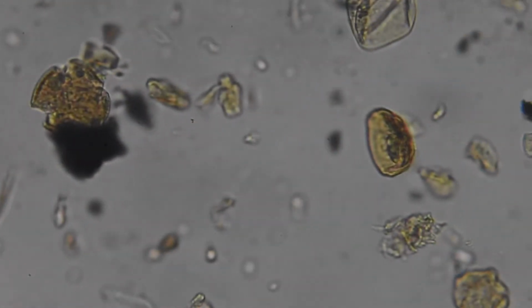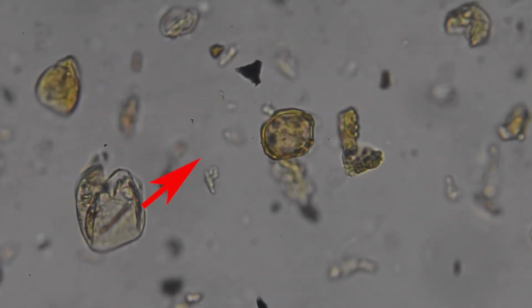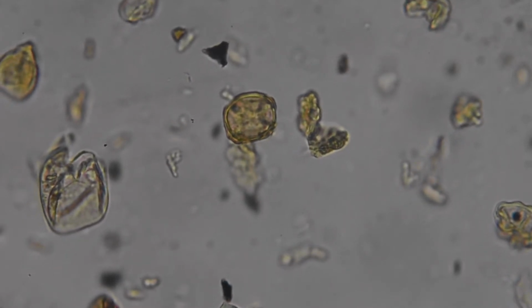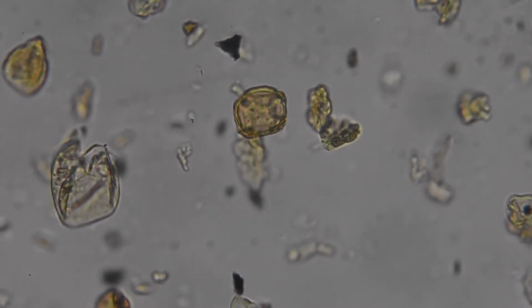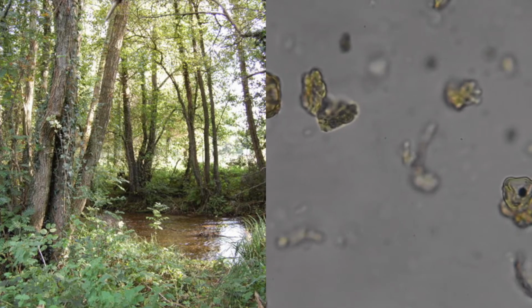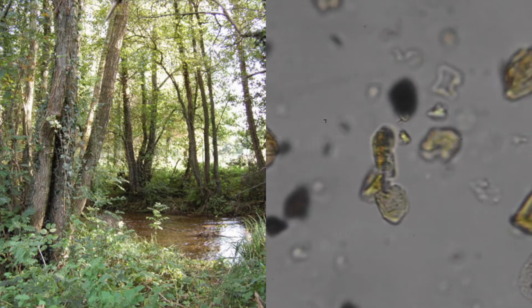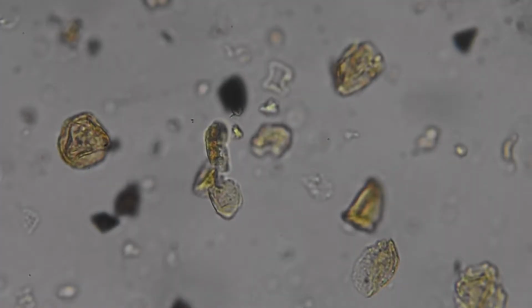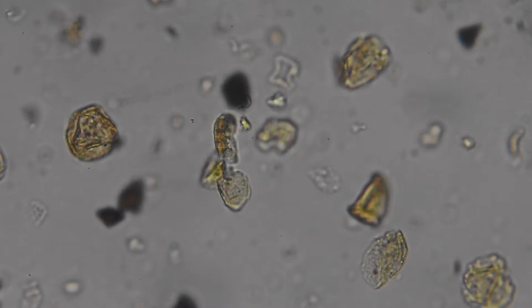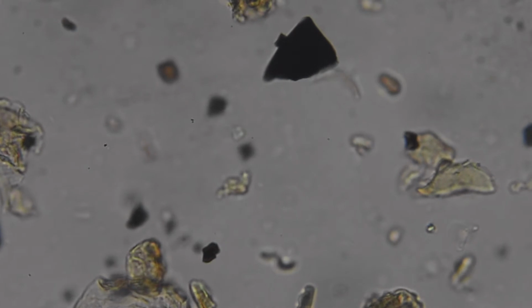Let's see what else we've got on this slide. That one there, again in the centre, is an alder pollen grain. And these have between 4 or 5 pores. So the other one we looked at just had 3. And this has got 4 around the outside, 1, 2, 3, 4. An alder is a tree that grows in wet places. It really likes to have its feet wet, so it likes to have roots somewhere close to water. So I can already start to tell you that we've got a landscape with some grass in it and some trees, and it's probably close to water. And we've only seen 3 pollen grains so far, really, to get that information from.